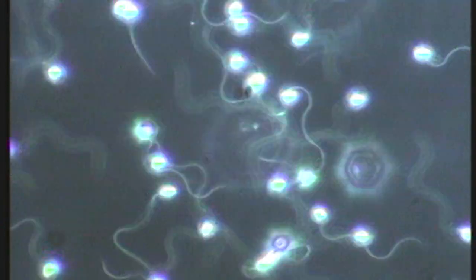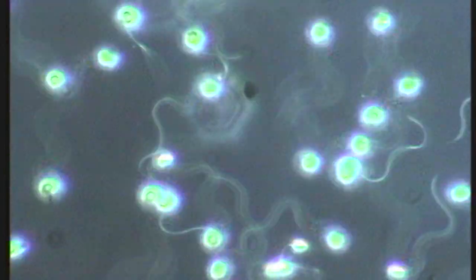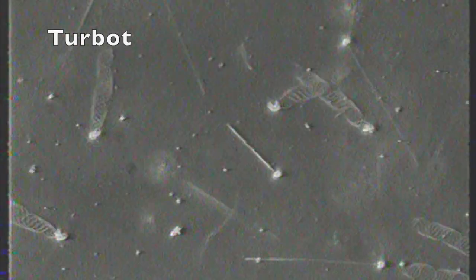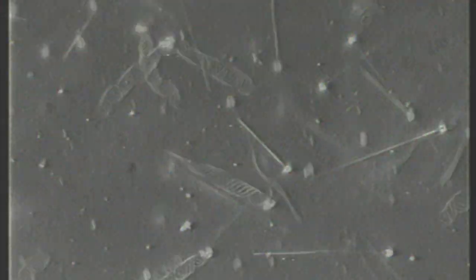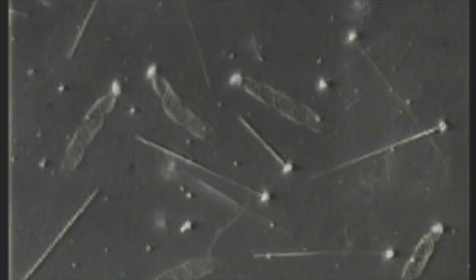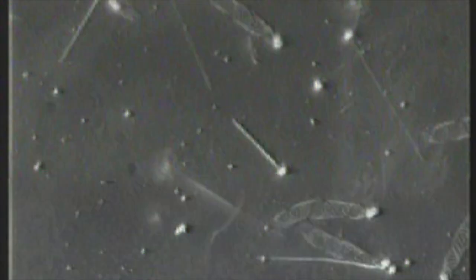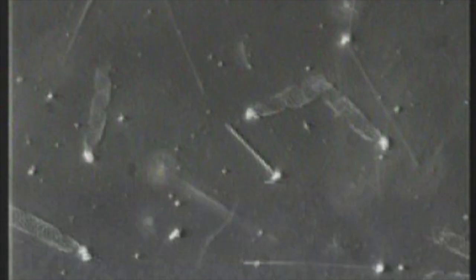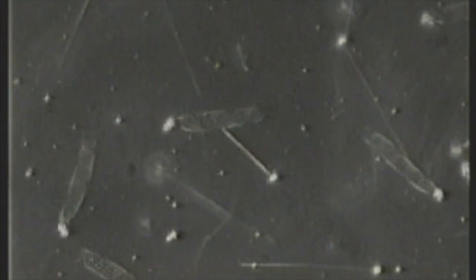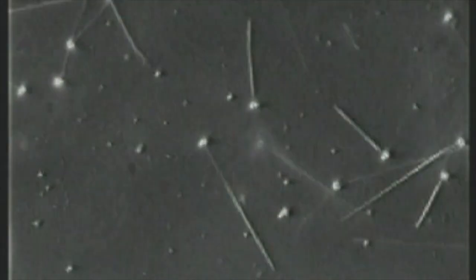They are marine species, so they swim in sea water. This is turbot spermatozoa which are stopped by application of CO2. At low speed we see that application of CO2 briefly stops movement and then flagellum waves reappear.